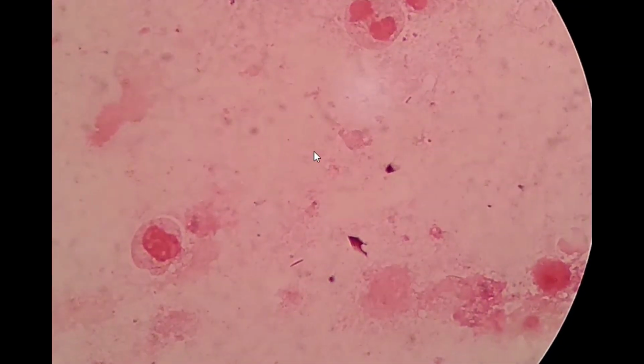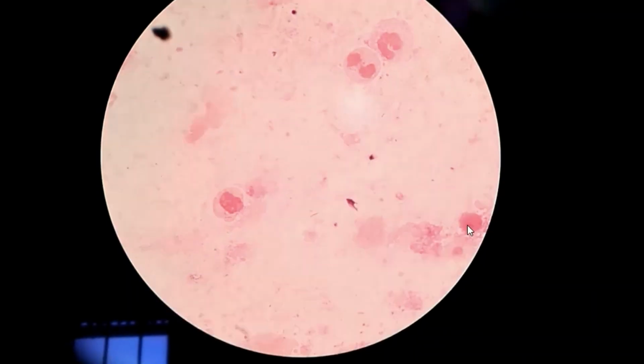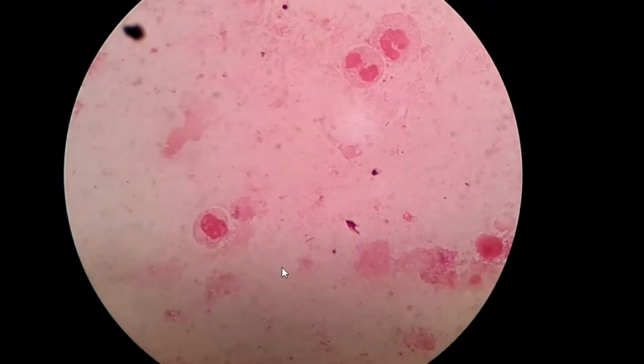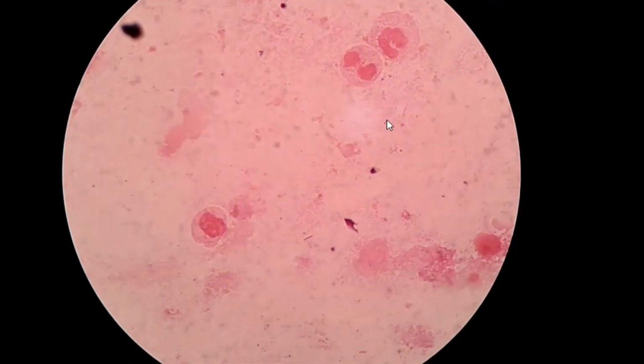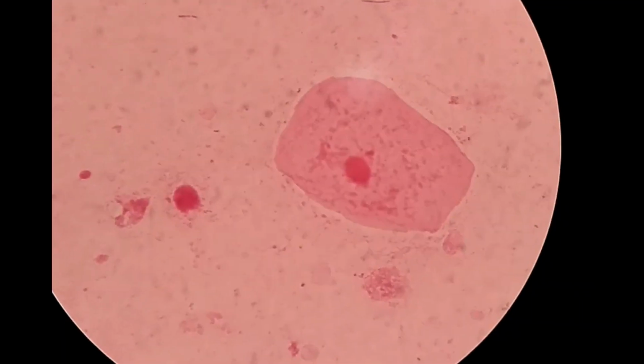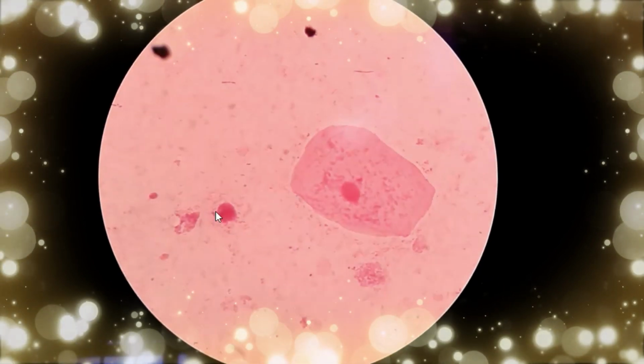So here you can see this is the oil immersion field. Here you can see this is the pus cell, this one is the pus cell, this is also the pus cell, and here you can see gram negative bacilli, this one too. And this is the epithelial cell at oil immersion field, and this is pus cell, this one is gram negative bacilli.